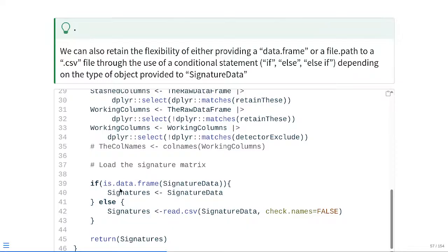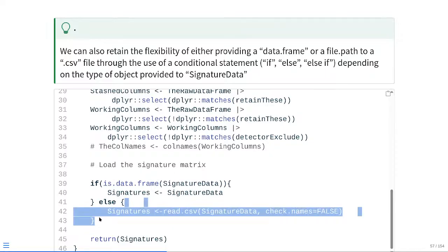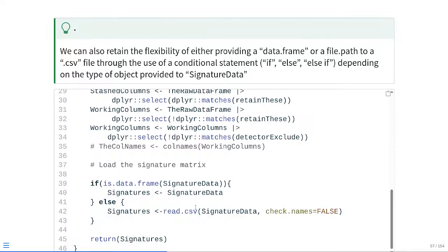Alternatively, if the object we passed in is not a data frame, let's say it's a file path to the CSV file, it would then pass it to read.csv. It would then pass off to the else statement, which will just go ahead and immediately read in. So anything within those curly brackets will now be actually executed. So as you can see, read.csv would read in the file path, check.names is set to false, so we're not changing any of the column names. And then this is all then being saved to a little signature object, and that's what will be used by the actual function itself. So note, regardless of which path is actually happening, we're still ending up with the same kind of name, signatures, so that way there's no deviating forks in what's happening inside our function.